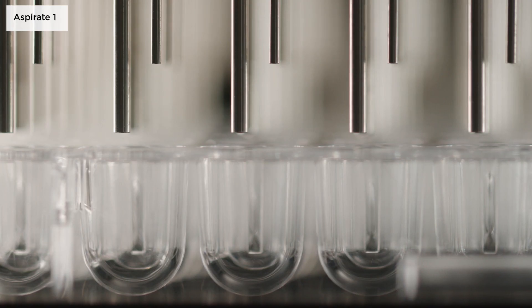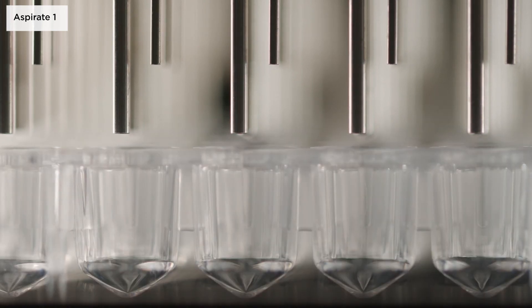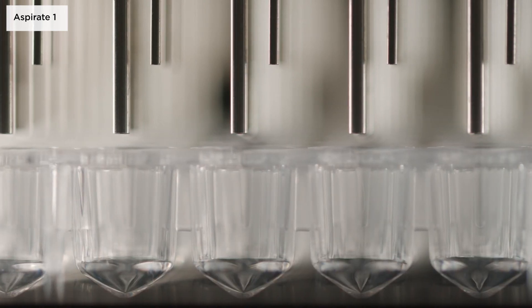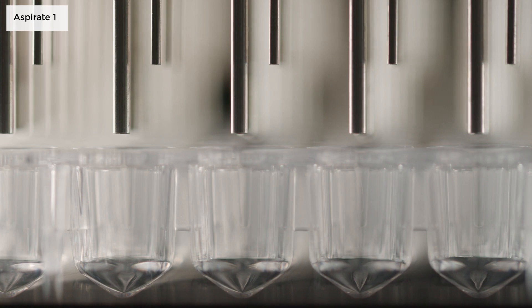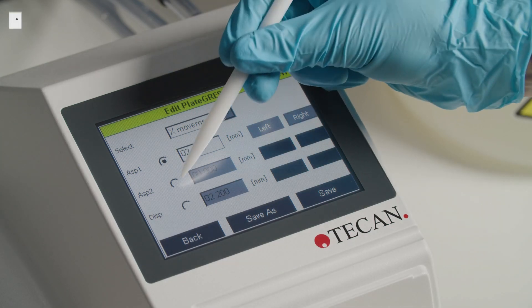Please note that for round or V-shaped well bottoms, the aspiration needles are placed in the centre of the wells. Once the position is correct, select the next position.